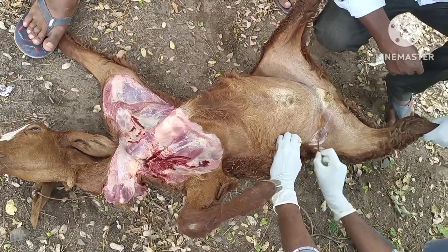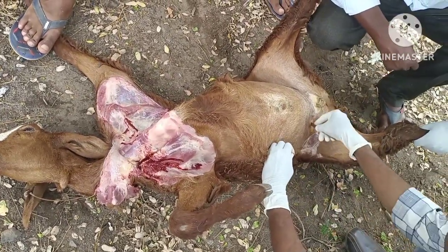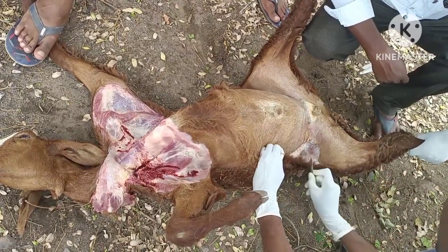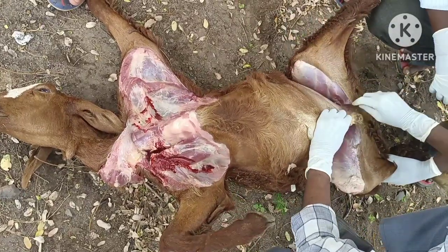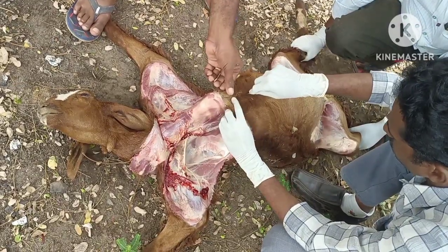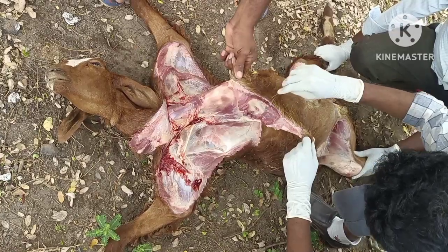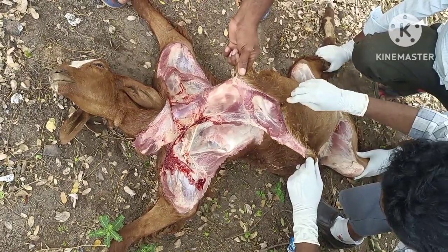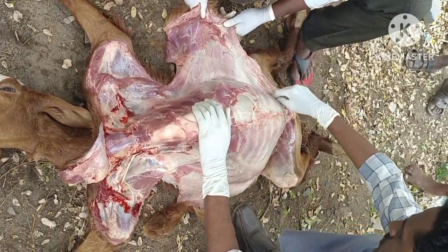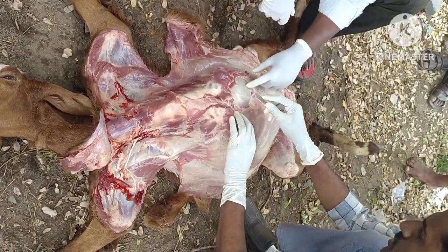After that, place the carcass on the floor and spread the forelimbs and hind limbs away from the body by disarticulating them from the shoulder and hip joints. Remove the skin from the breastbone throughout the ventral region, and observe for any hemorrhages present on the muscles.